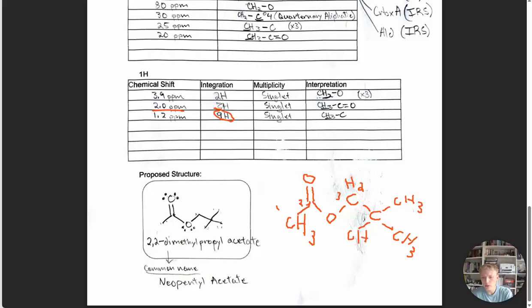And now we can go back to some of the CNMR 20 to 30 values and start to assign which carbons are going to receive which ppm. Okay, so now we have the equivalent hydrogens. Our hydrogen placements and orientation checks out. We've assigned the bonds to the HNMR spectrum, and now we pretend like this is empty and we're going to fill this in. Okay, so the CH3 attached to the carbonyl carbon is going to take the lowest ppm value. Now, why is this? The methyl that is adjacent to this carbonyl carbon is going to take the lowest value because this oxygen is more strongly pulling electron density.